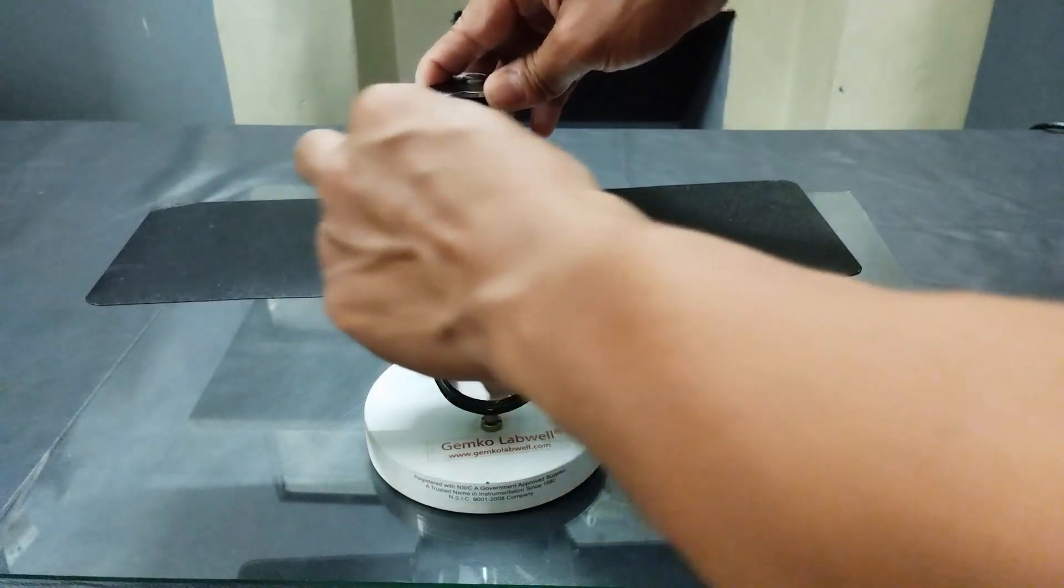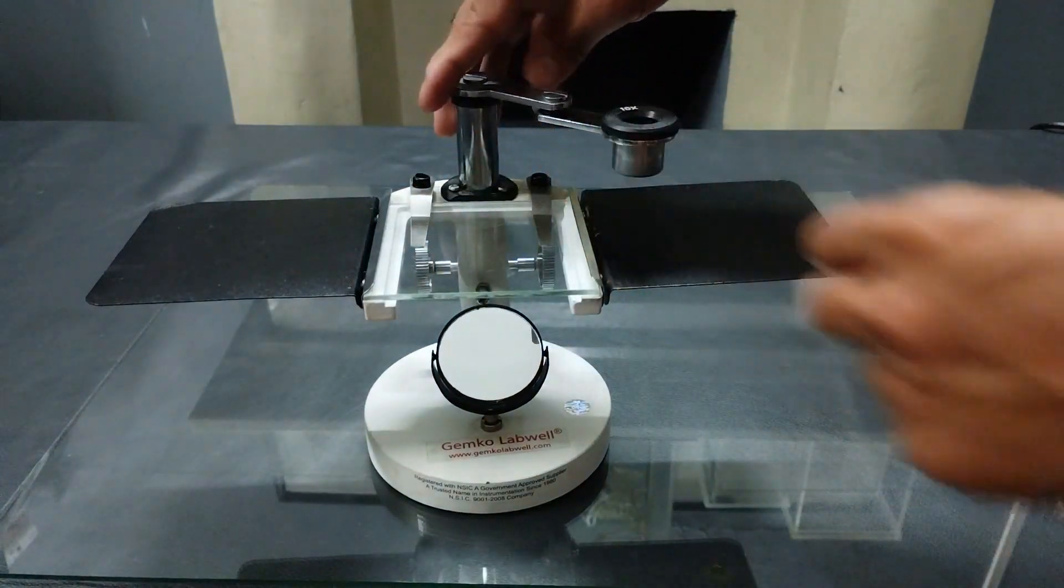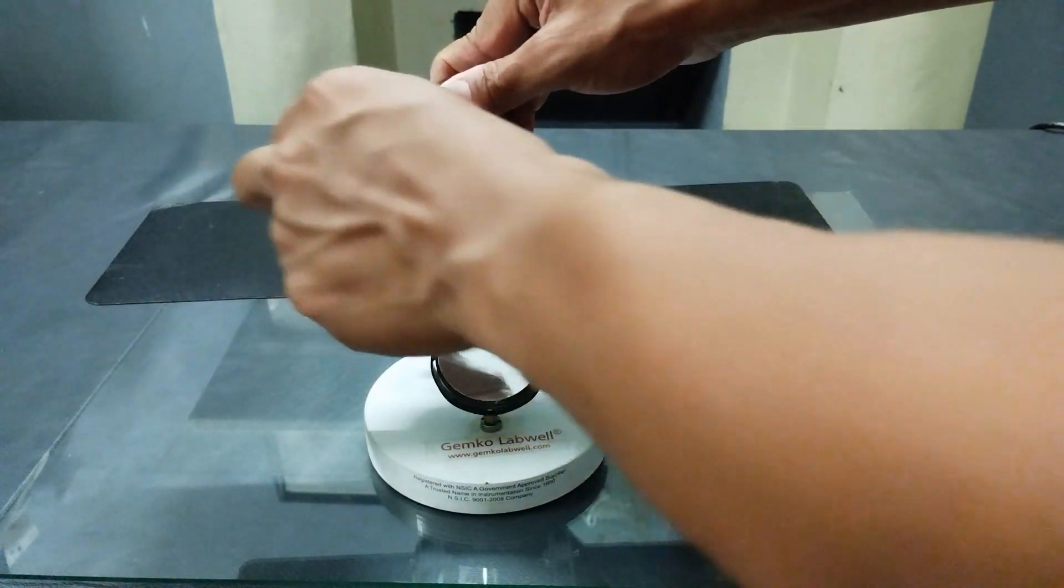The foldable arm can be extended to any region of the specimen for further examination without the need to constantly move the specimen around the stage.